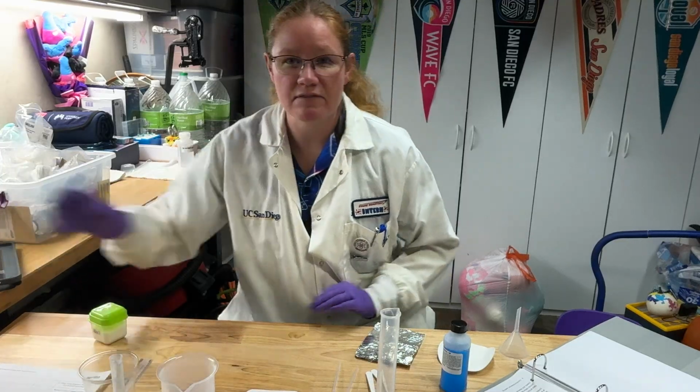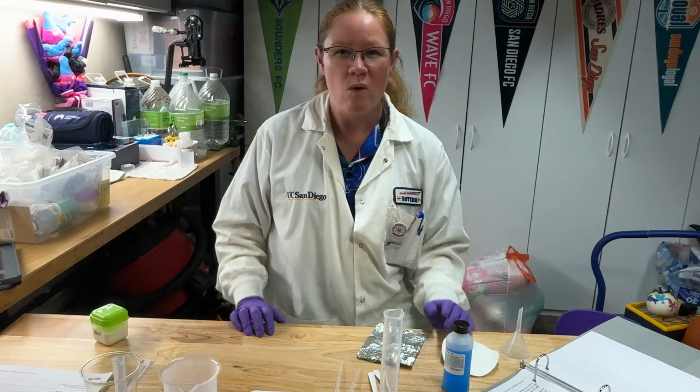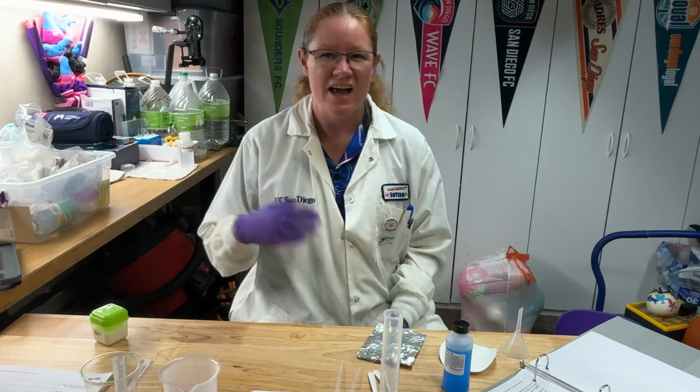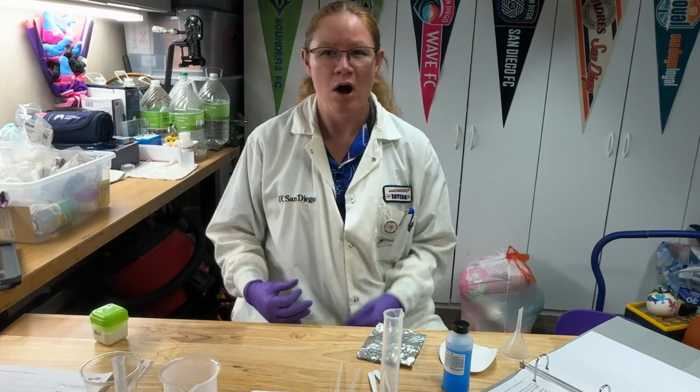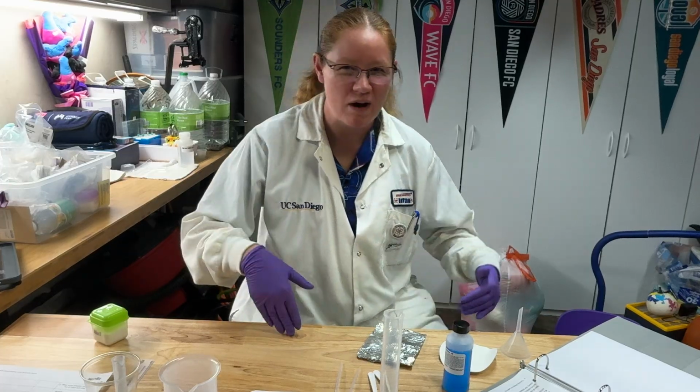Okay, if you want to have your oven ready to go, you can heat it to 225, or you can finish the reaction first and then worry about your oven later. But if you want to use your time efficiently, you can let your oven preheat while you're doing this portion of the experiment.